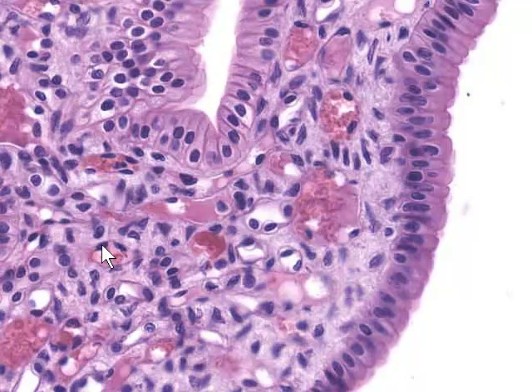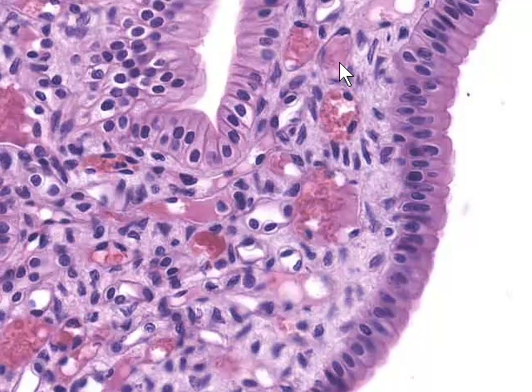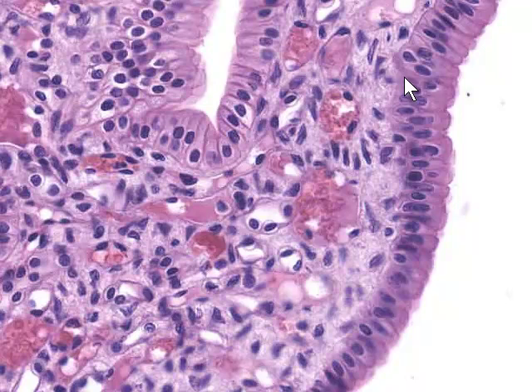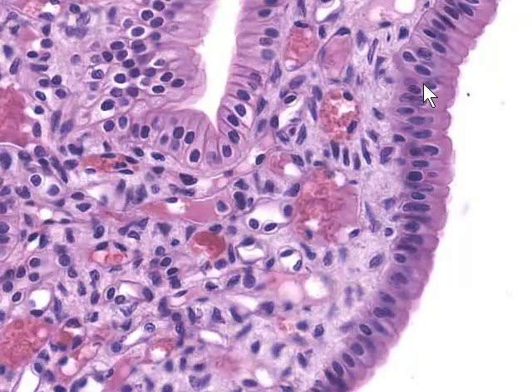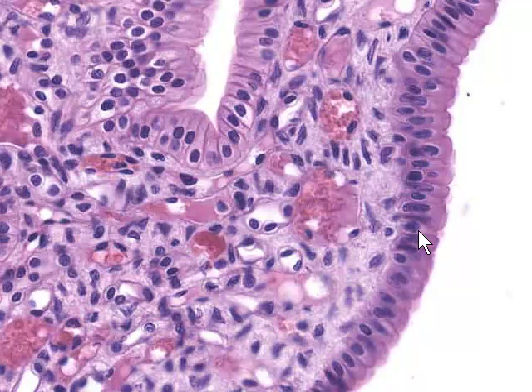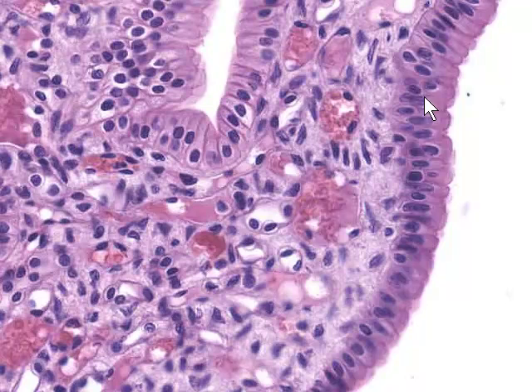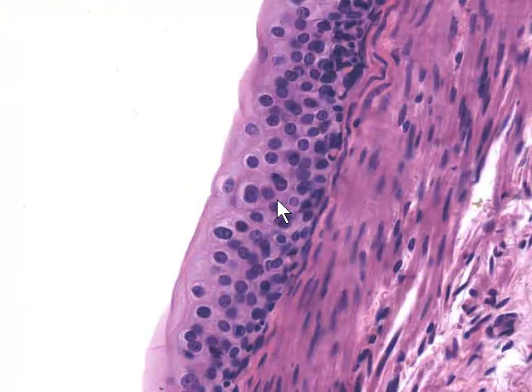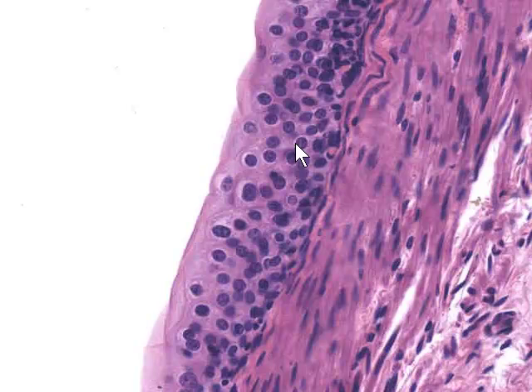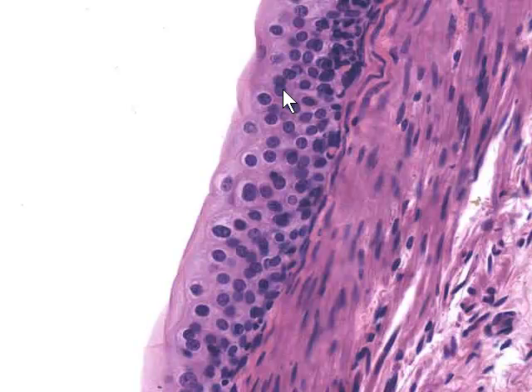Interspersed among these we can see cross-sections of structures filled with red blood cells — these will be vasa recta and other blood vessels that supply the medulla. Here we see the epithelium lining the surface of the tip of the medullary pyramid: it's either a simple or perhaps stratified epithelium, and columnar is the cell shape we see here. Now we'll proceed across the gap through which urine would drip until we encounter the epithelium lining the renal calyx, which is the same epithelium found on the renal pelvis, the ureter, and lining the urinary bladder.